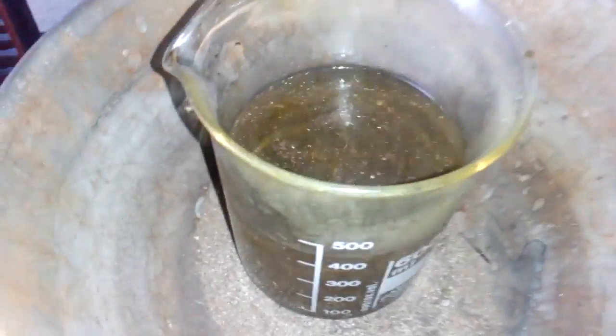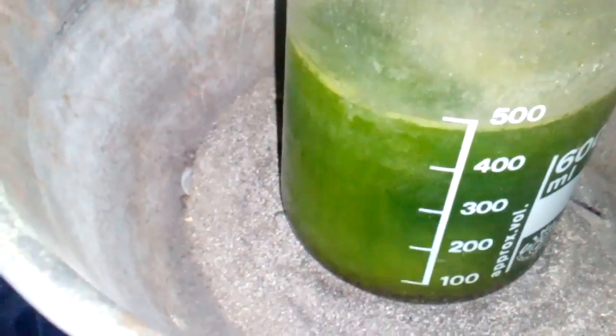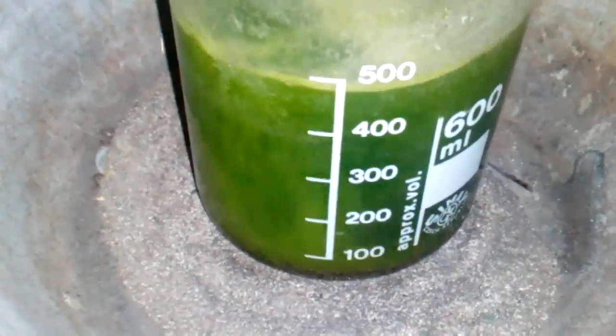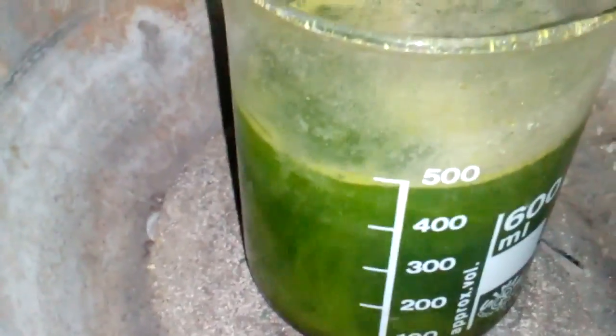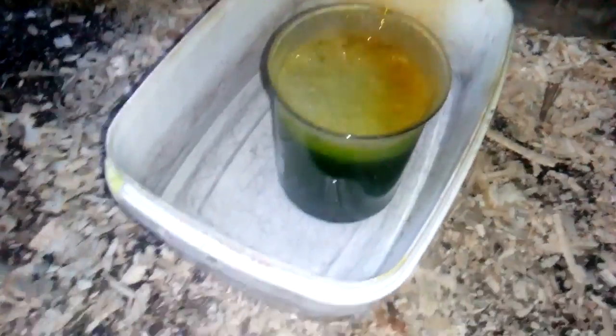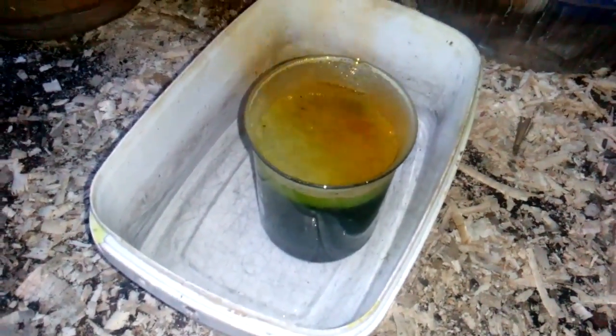And this is a new batch because we got a lot of pins here. We will make some new Aqua Regia. This is our second batch. Got a very hot reaction, but no heat. Just a little heat, enough for the start. If your solution goes to boil over the edge, move it from the heat. Put it on the side, to cool.